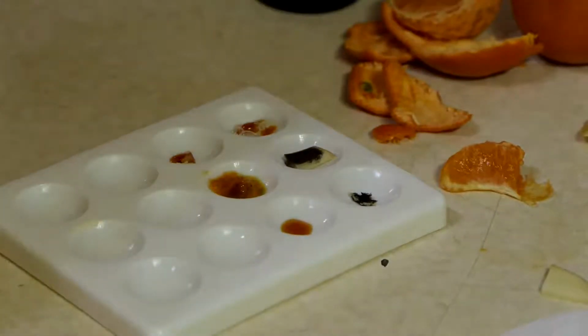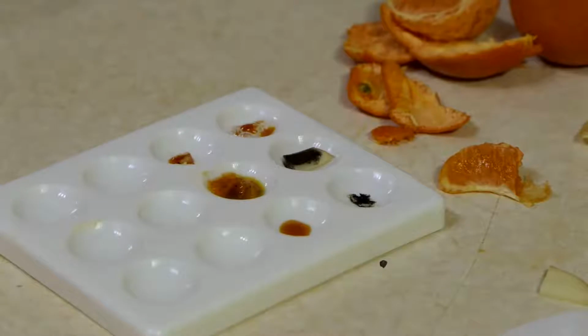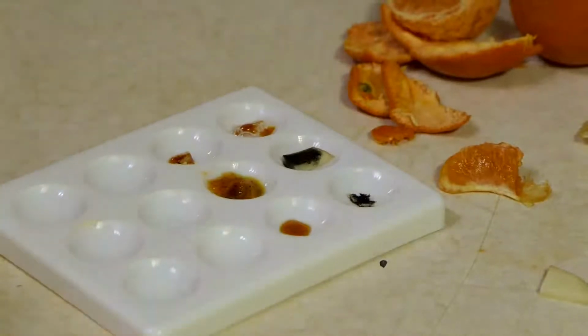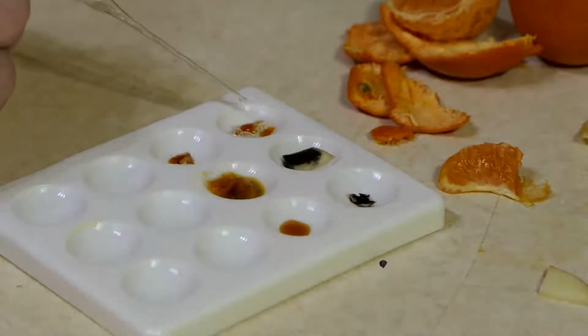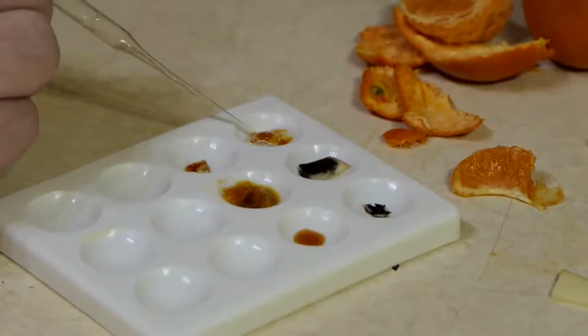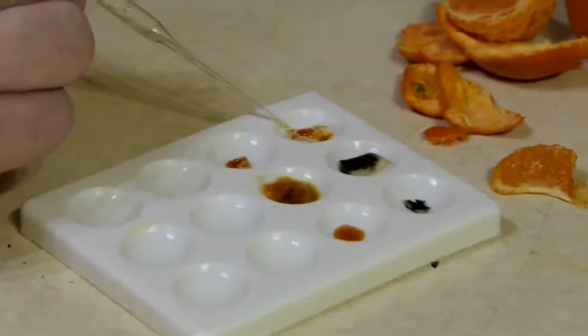Right. So Paul, hopefully zooming in on this so we can have a look at it. Yes, you're doing well. This is my egg, and it's still nicely brown, so there appears to be no starch in egg. So I'm going to record that. So my egg, no.